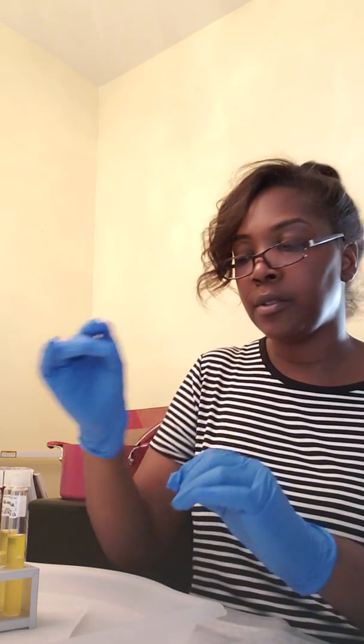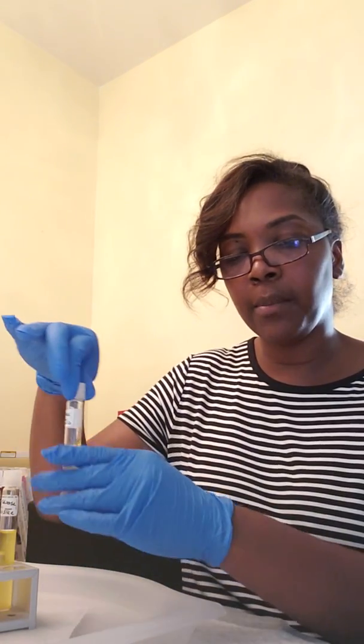This is the lab exercise video for biochemical testing for microbial identification by carbohydrate fermentation testing. The purpose of this test is that it's another technique to identify unknown microorganisms by the fermentation technique, which occurs when the carbohydrates are broken down anaerobically. So I took 6 tubes 24 hours ago.